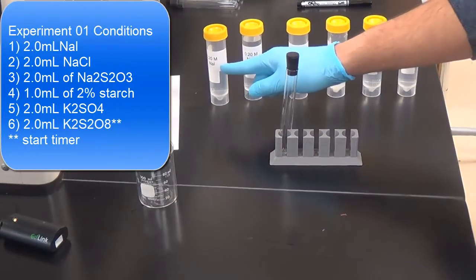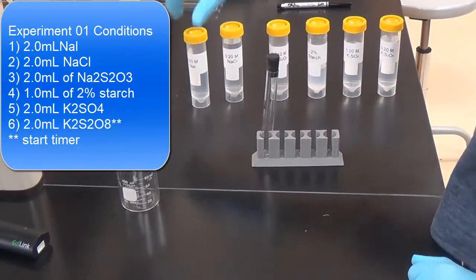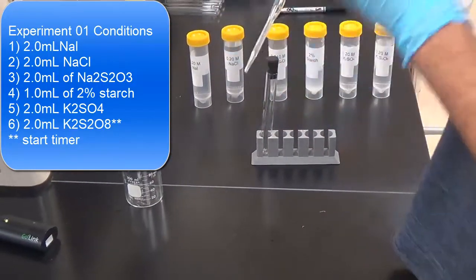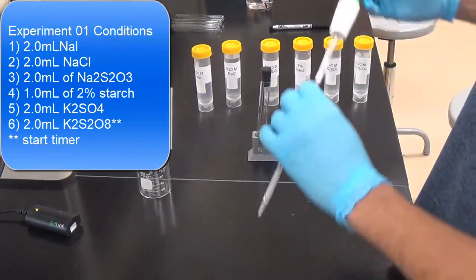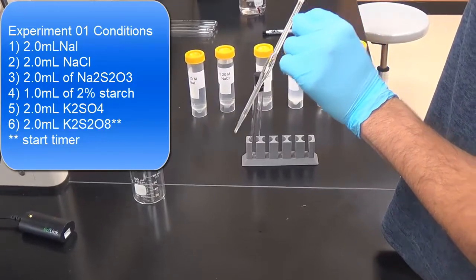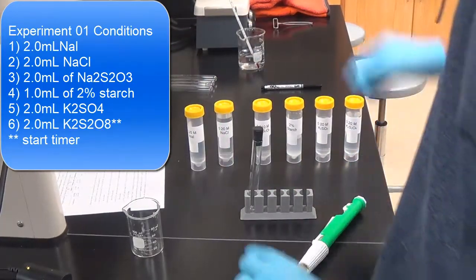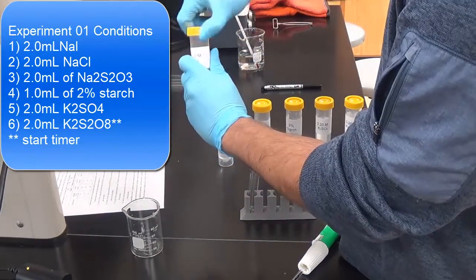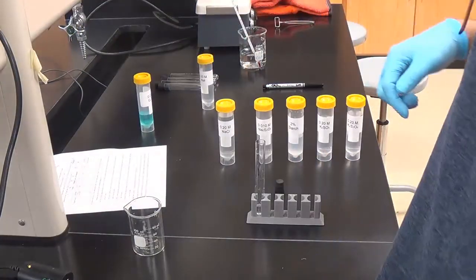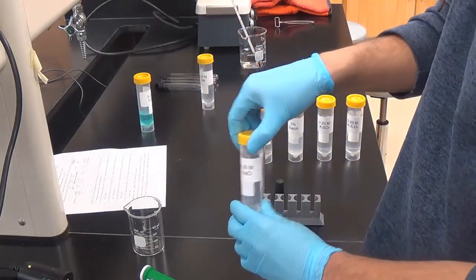So just a word here, all of these are the same concentrations throughout. The only thing you're varying is the volumes. So to get this as accurate as possible, we're going to use these glass pipettes. It may take a little bit of fudging to get to about the 2 milliliter line, which is about here. So watch your line, and let's go ahead and do this. Remember, a very specific order. Experiment 1 is going to be 2 mLs of this. Now NaCl. According to experiment 1, the volume is 2 mLs.